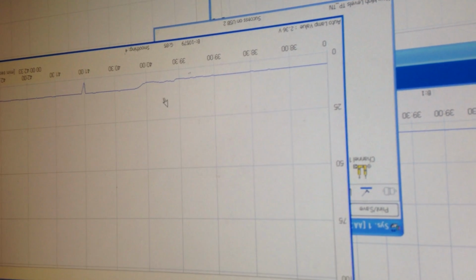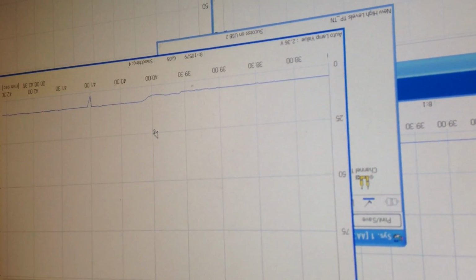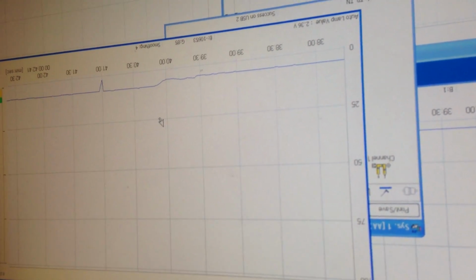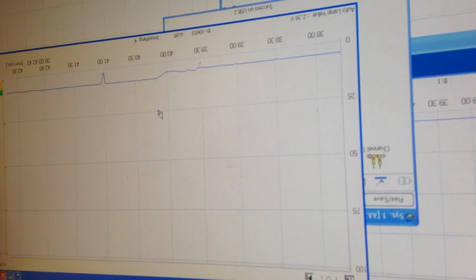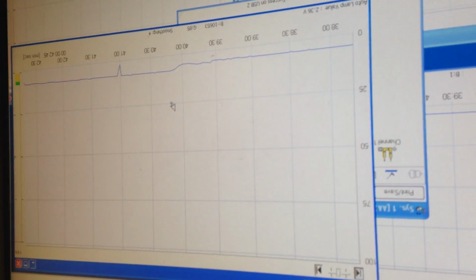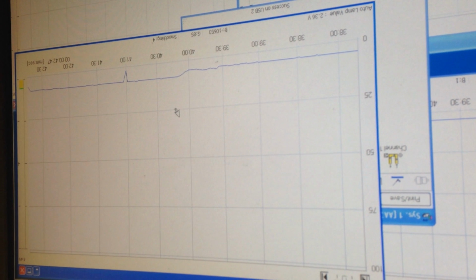Put the background matrix on, I expected to see a little bit of a bump. There really wasn't one. So that might be a problem, but we'll see once we do the spike timing whether that really was a problem or not.